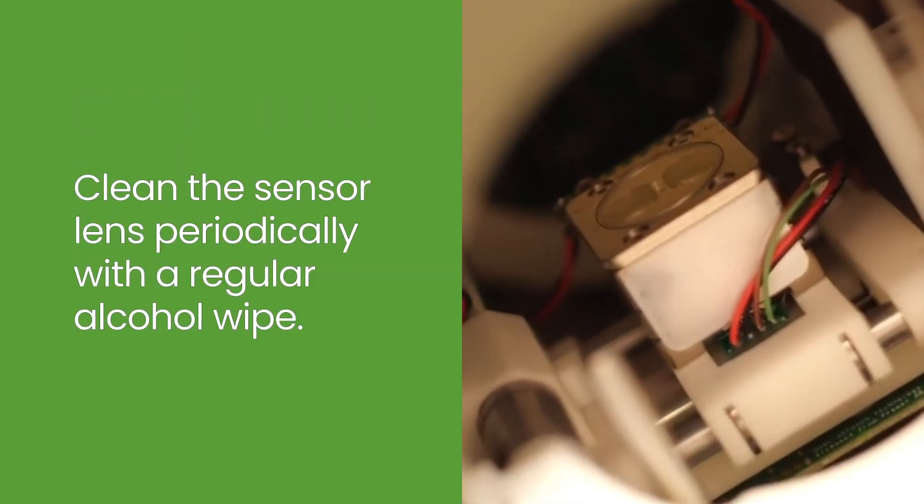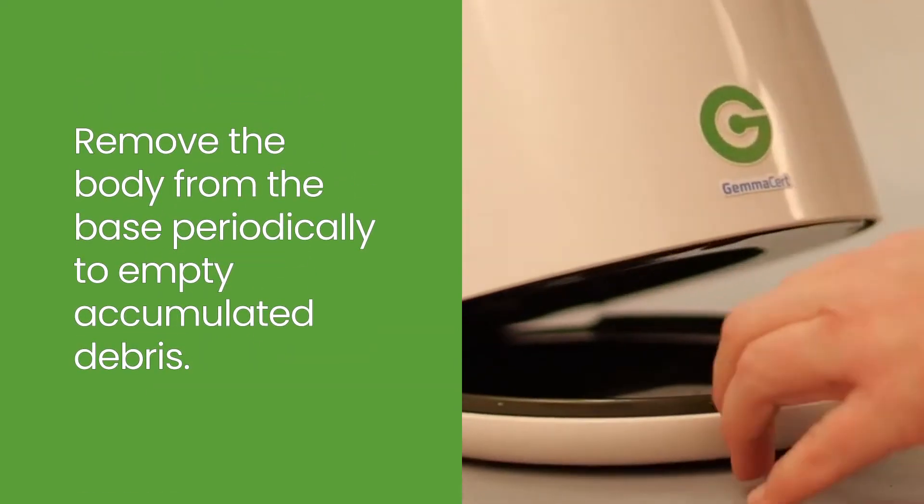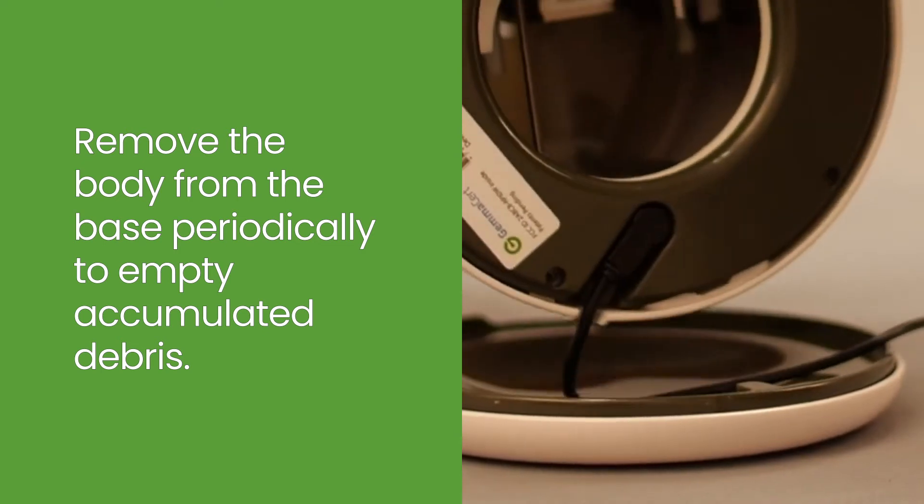Clean the sensor lens periodically with a regular alcohol wipe. Remove the body from the base periodically to empty accumulated debris.